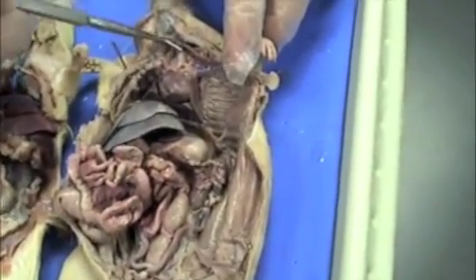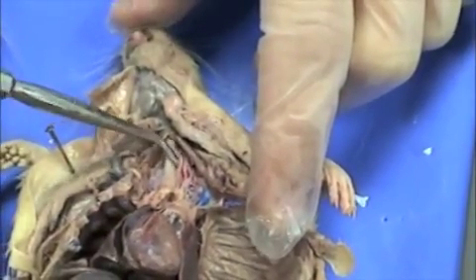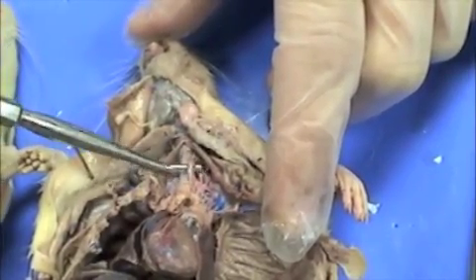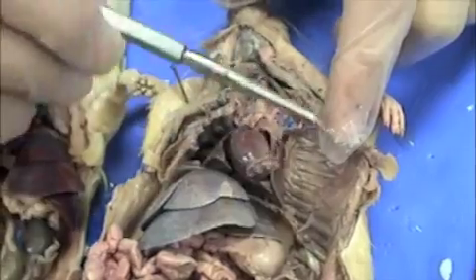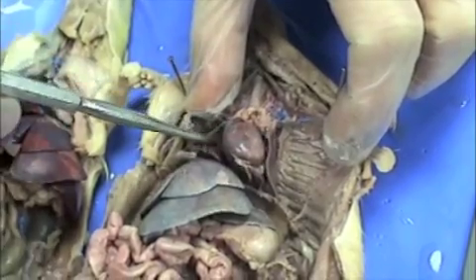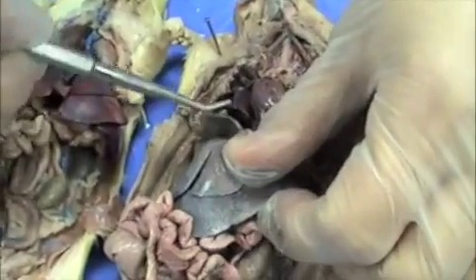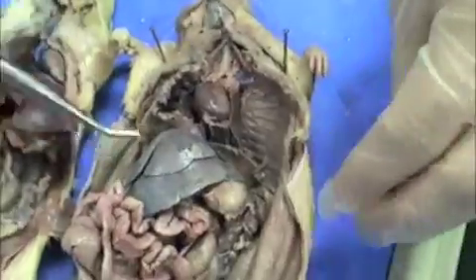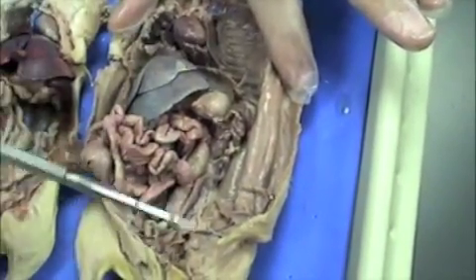This is the female rat. This is the trachea here — the white rings on it look like a vacuum cleaner hose. This is the esophagus lying just posterior to it. Here's the heart, and here are the lungs on each side of the heart. The lungs lie in the pleural cavity. Then we have the diaphragm — this thin muscle flap here. It's been cut away so that you can open up the rat, but it separates the thoracic cavity from the abdominal pelvic cavity.